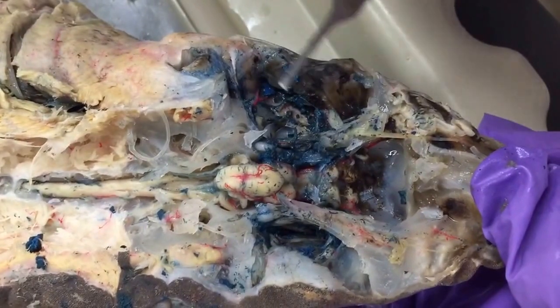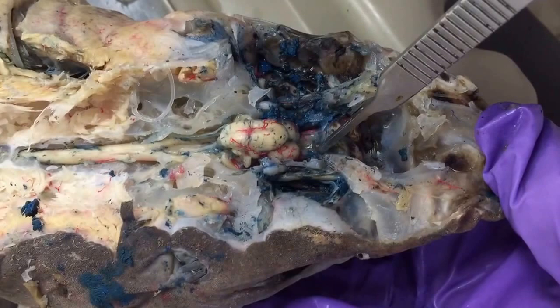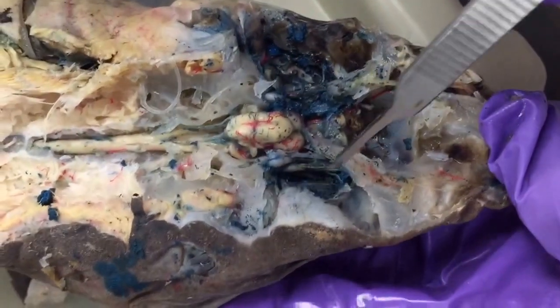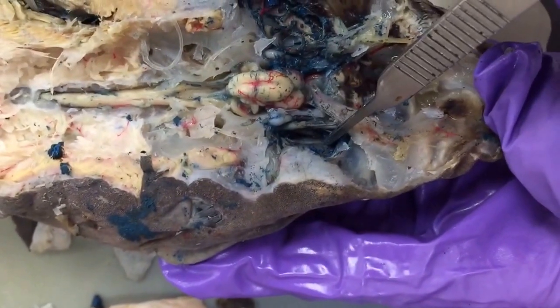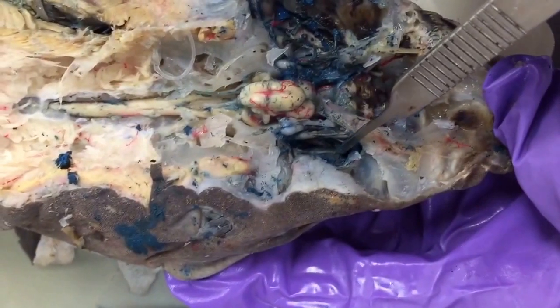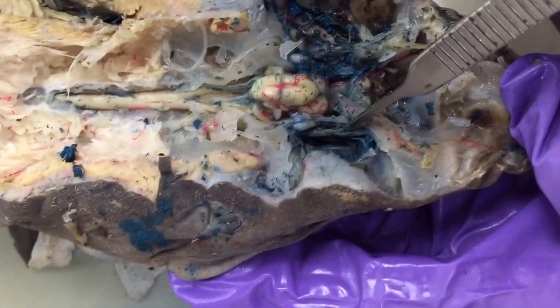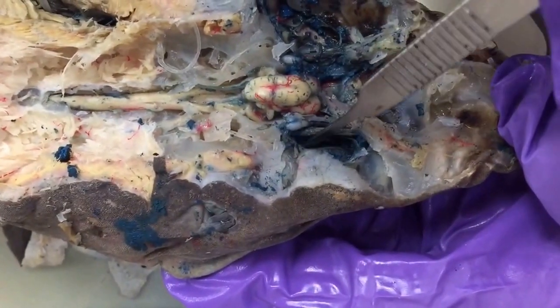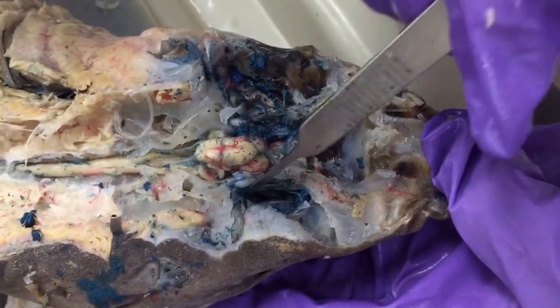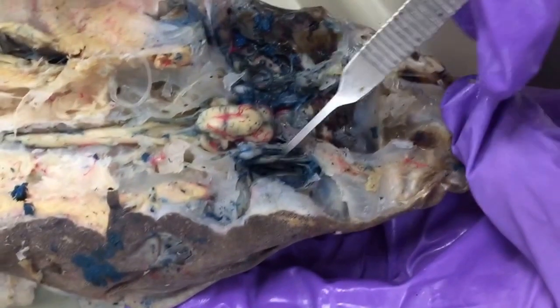Now you can see the eyeball has actually been removed from this side, but on this side you can see the infraorbital trunk here with the eyeball here intact, and the, is it the deep ophthalmic nerve? The deep ophthalmic nerve is a little bit smaller than the infraorbital trunk here, and the deep ophthalmic runs actually on the surface of the back of the eye, whereas the infraorbital trunk is thicker and a little bit more medial and not directly attached to the eye.